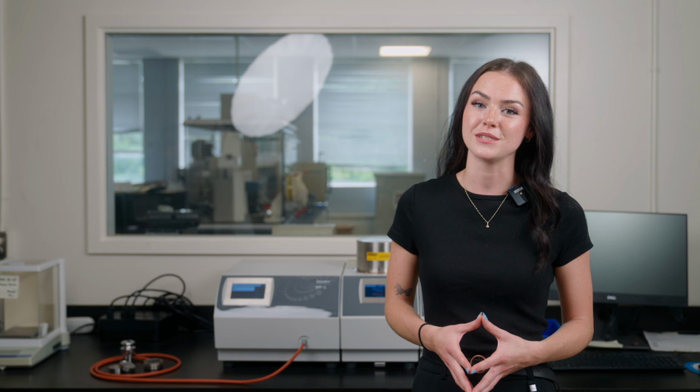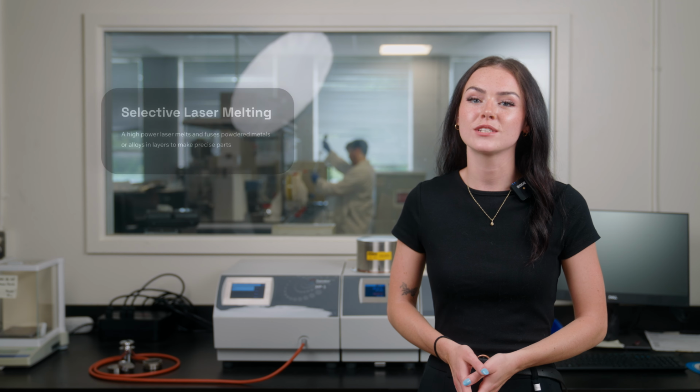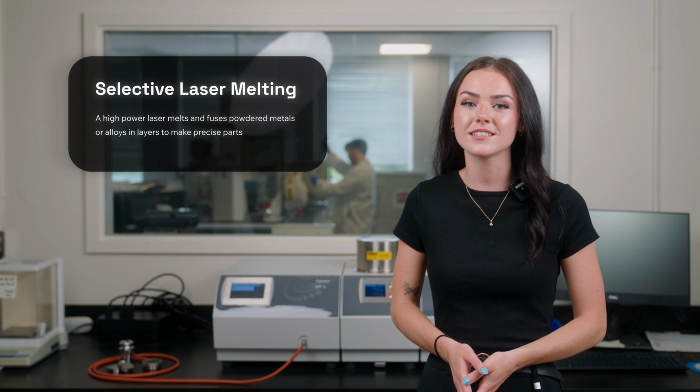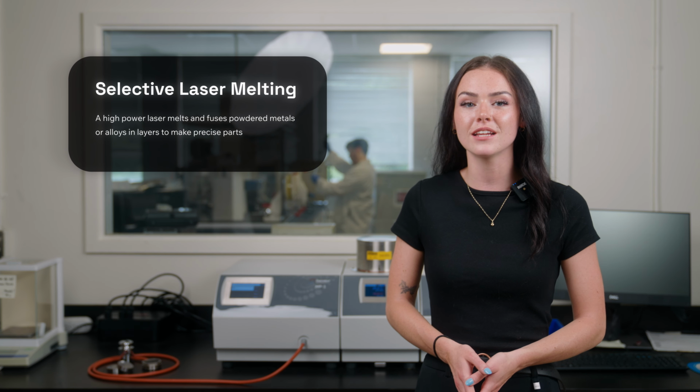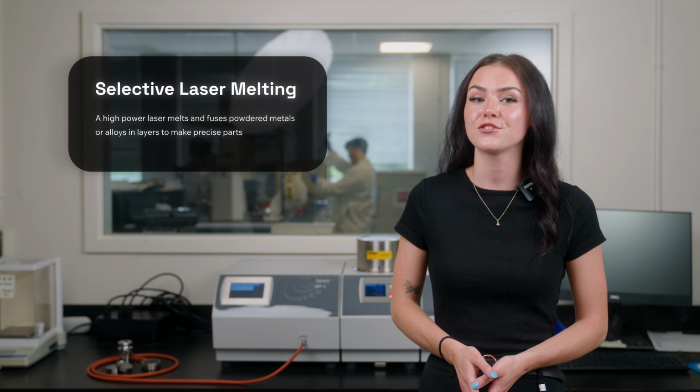In part 1, we measured the thermal conductivity of a few common solid metals used in 3D metal printing. They were measured using the MTPS sensor available on our advanced MP-1 platform. Today, we're going to repeat these measurements on the 3D printed metal samples. The method used for printing these metals was selective laser melting, which utilizes a high-power laser to selectively melt and fuse powdered metals or alloy materials layer by layer to create a complex and precise 3D part.